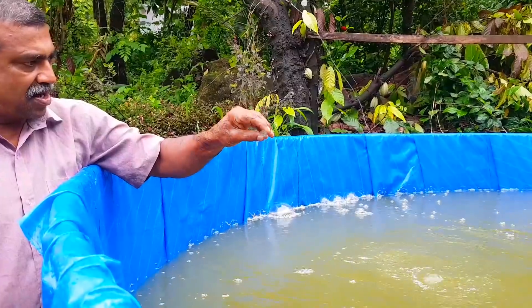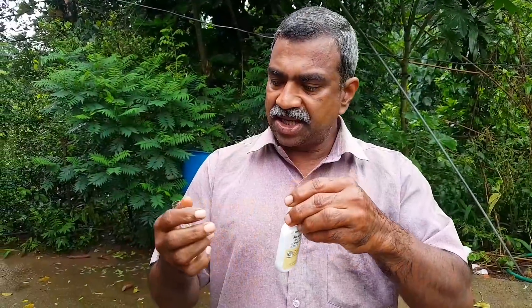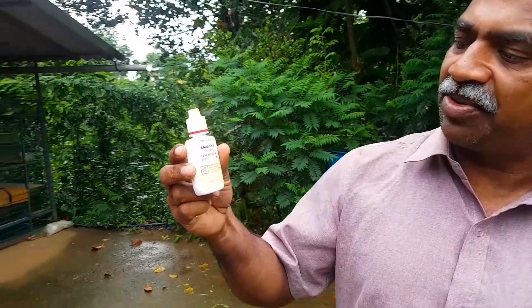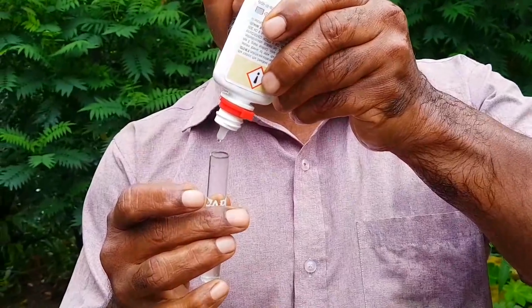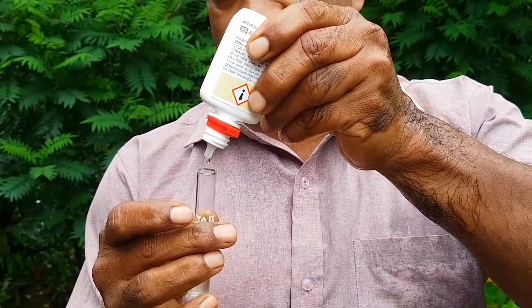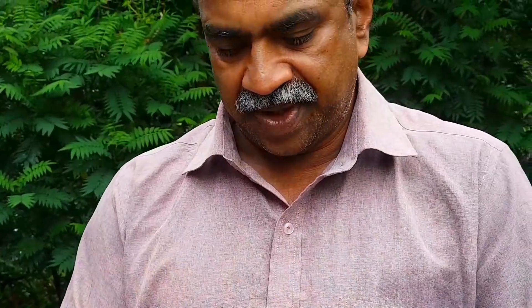Let's take a look at the mark and take a look at the test. Let's take a look at bottle number 1. Now we will add the solution to bottle number 1. Add it — this solution.